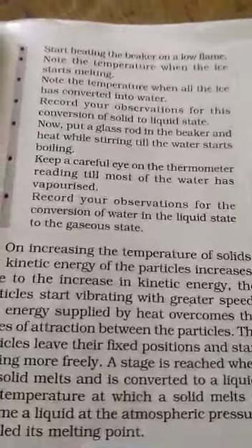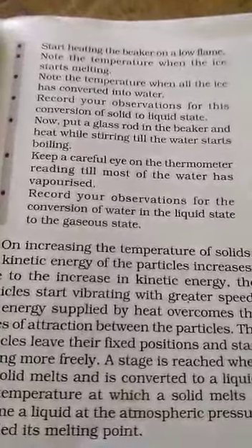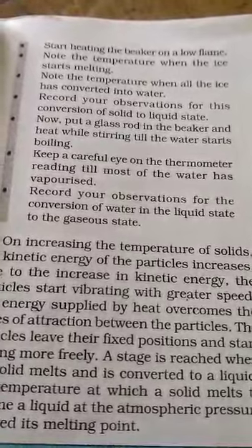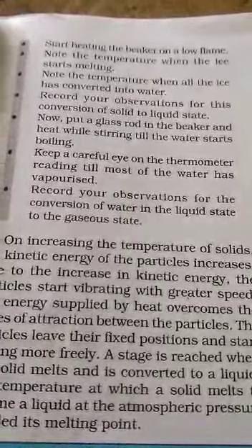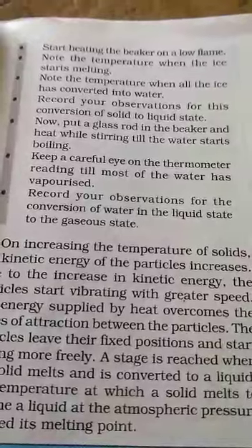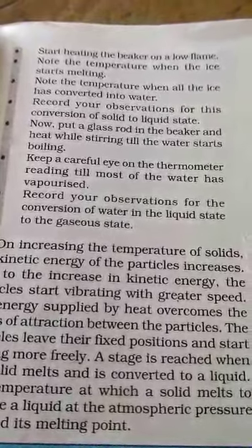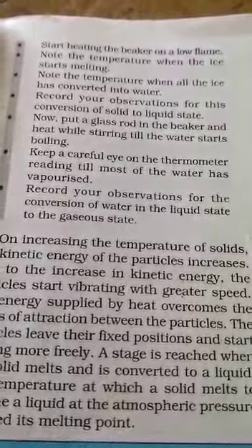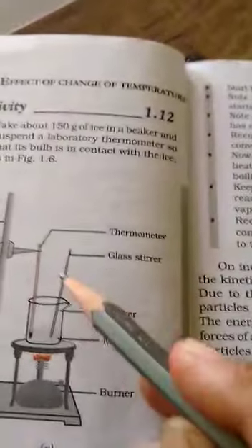As the ice starts melting, note the temperature when all the ice has converted into water. Record your observation for the conversion of solid to liquid state — from a solid to a liquid. Now put a glass rod in the beaker.